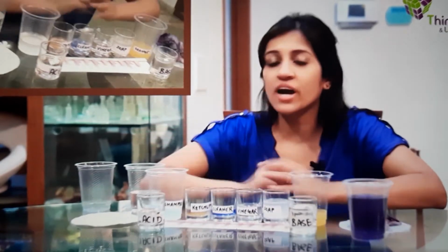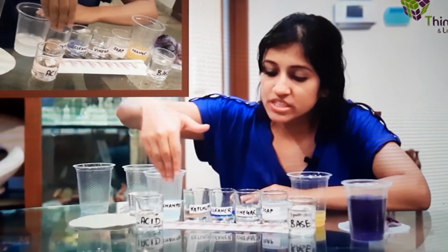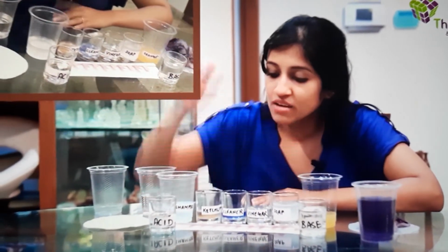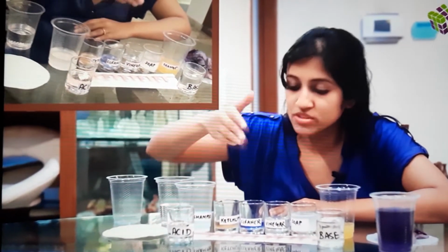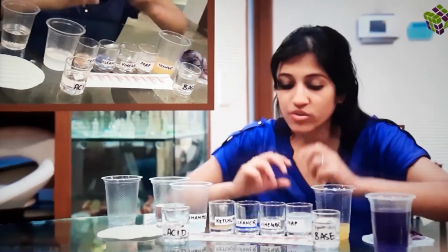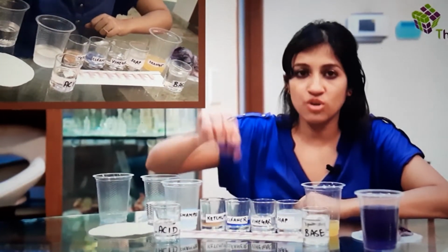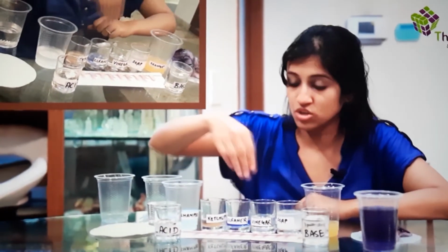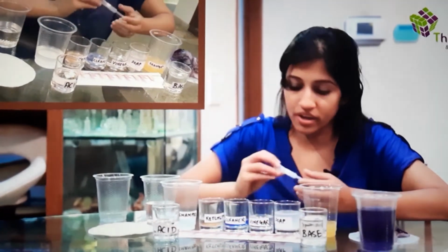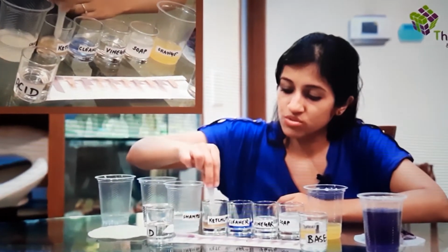Okay, so let's start with the litmus test. As you can see over here, I have some litmus paper, very neatly arranged. Blue litmus, red litmus, blue litmus, red litmus, blue litmus, red litmus, placed in an order. And what we're going to do is something very interesting. We're going to take drops of the various aqueous solutions, put them on the paper, and see what happens. So let's start with ketchup. Just a little drop would do.